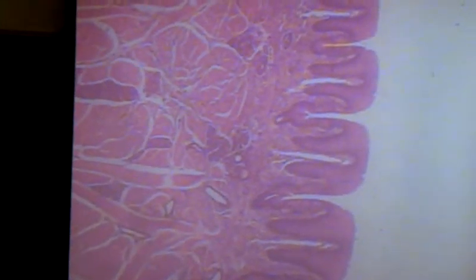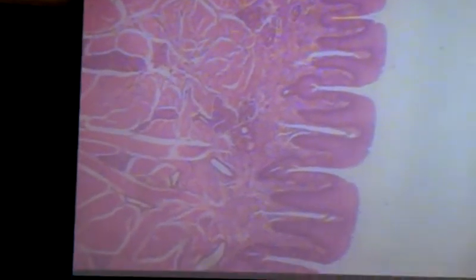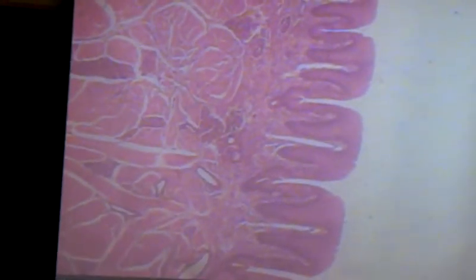When you get your tongue slide and you're around it under low power, what you're looking for is this edge that has these large bumps on it. What you don't want is one of these cut edges over here. We want this surface with the bumps.